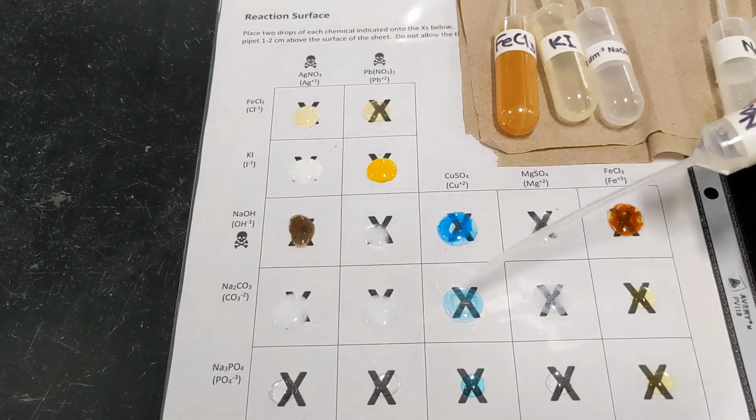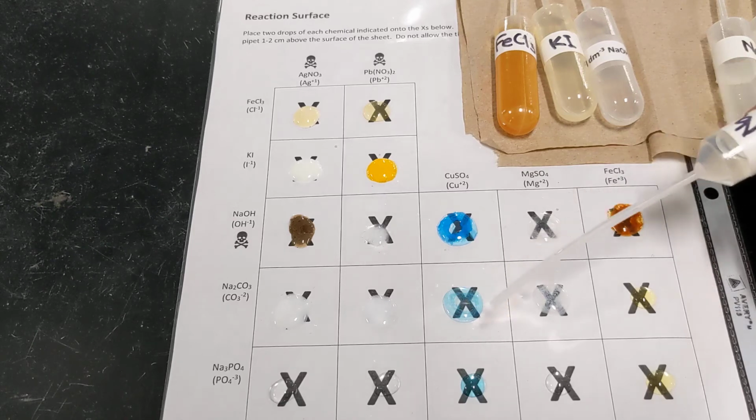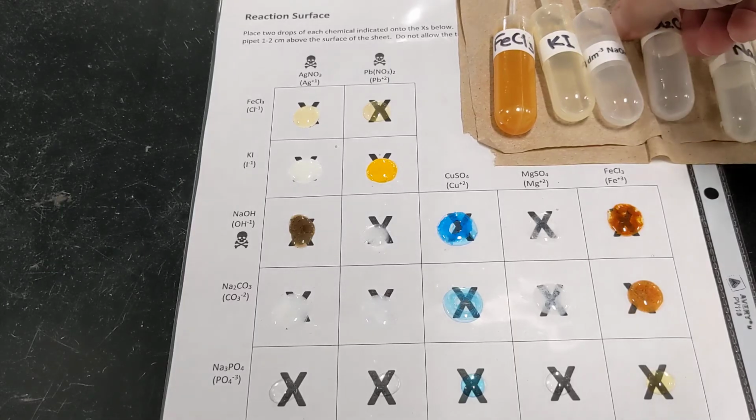Oh, going back to the previous box, yeah, I can see again some wispy precipitate forming. This is more of a light blue color. Where the one above was medium blue, this is more of a light blue color. And then our final reaction mixture, okay, another precipitate has formed, right? So we're making lots of new ionic compounds.